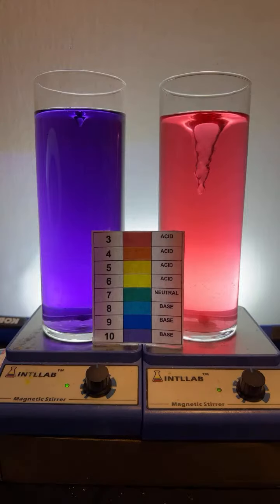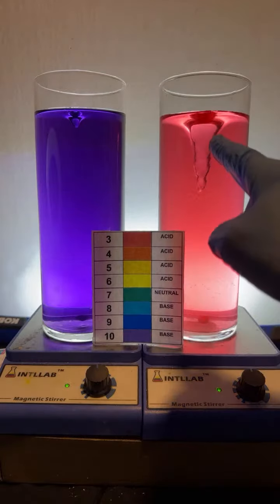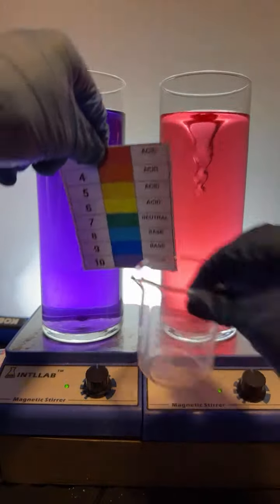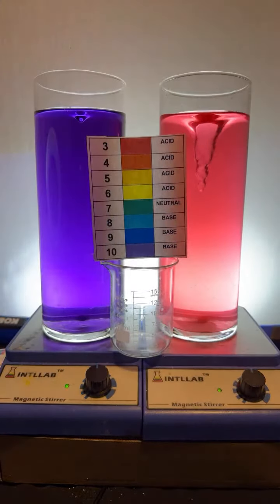And now what I will do is I will mix the two. Let me find my beaker for mixing. Forgive me a second, I gotta find it. Here it is. The question was, what happens if you mix the colors when they're acidic or basic? So what do you think is gonna happen? I'm gonna mix some of this and some of this in a beaker. Let's give it a shot, see what happens. You should be able to guess what's gonna happen if I do this.